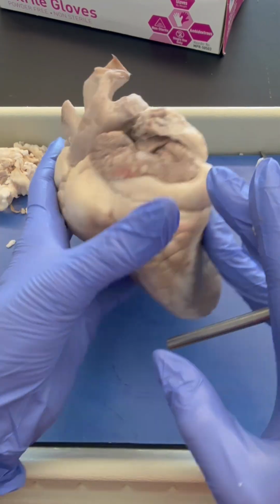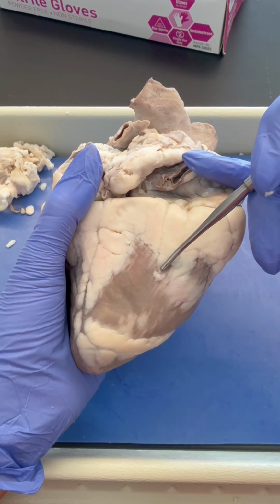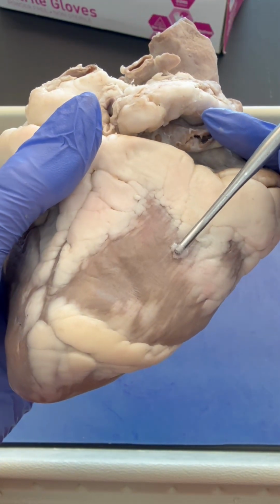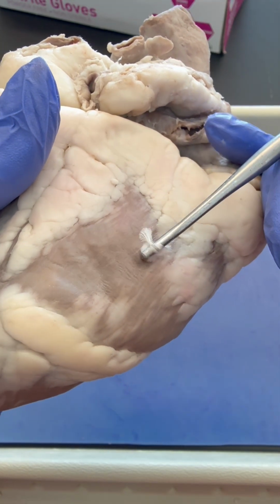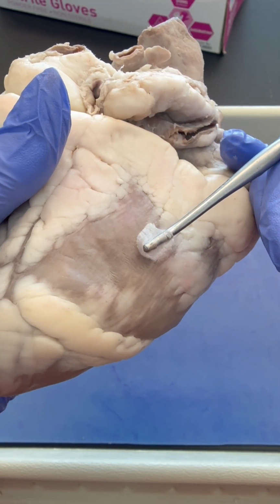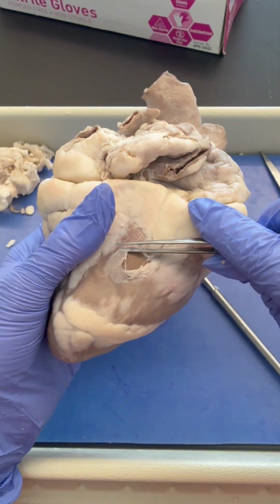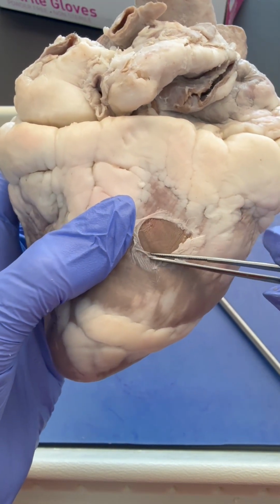I also went ahead and took my scalpel and I cut the smallest little sliver on the posterior surface of the heart. And I just want to show the visceral pericardium. Think of it like a saran wrap, like a real thin layer of connective tissue that surrounds the heart. You can see the myocardium underneath. So the myocardium is that nice cardiac muscle itself.